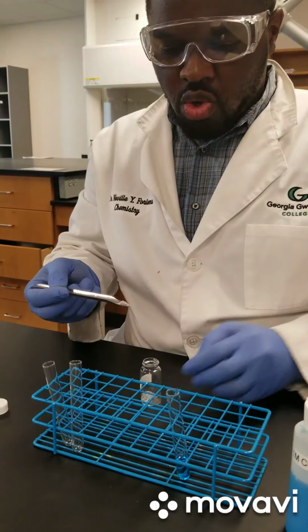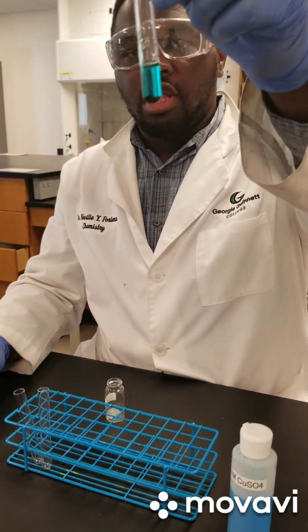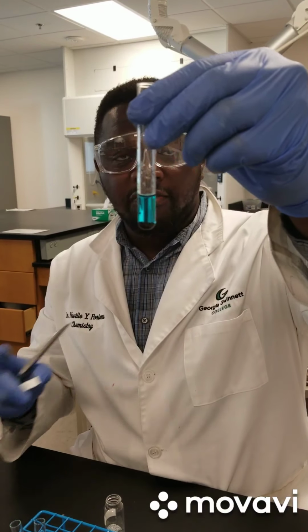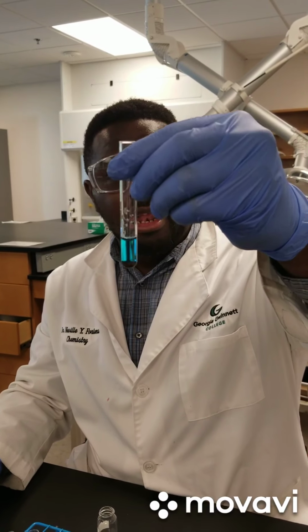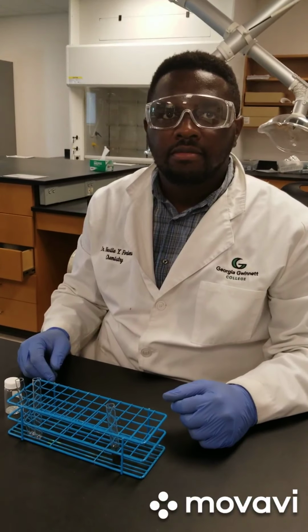into your copper sulfate solution, and you can observe the initial appearance of what has happened to the reaction. I will pause the video and move on to reaction F, then come back later in about 10-15 minutes, so we can make a final observation of what has happened.